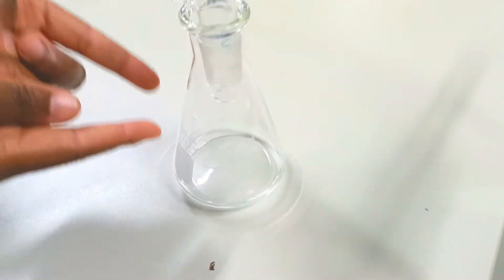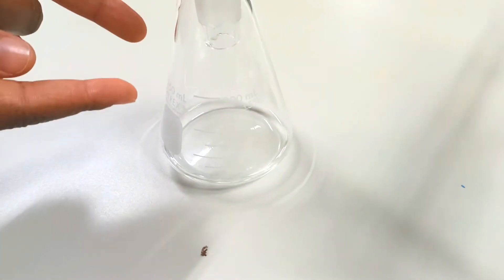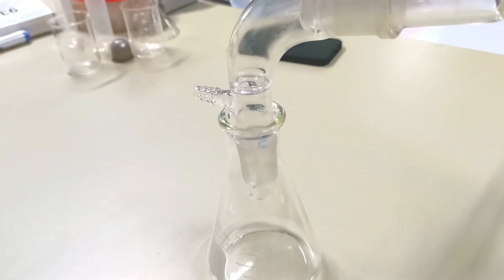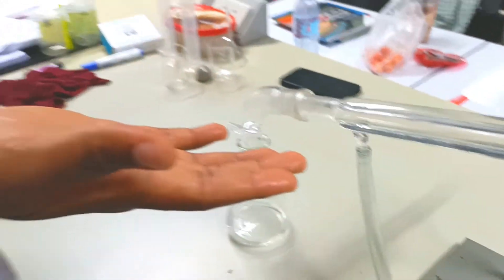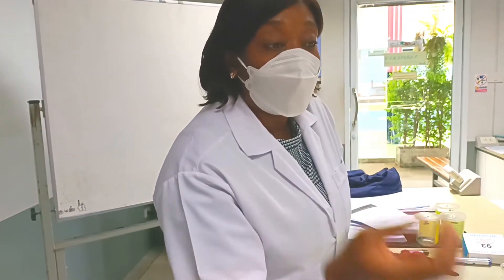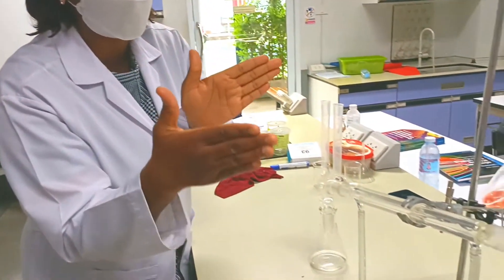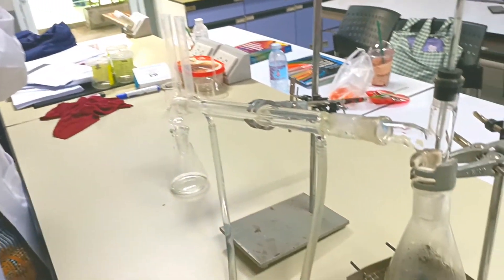So in here, we expect to have our ethanol. By using this method, we separate two mixtures with different boiling points. This is quite similar to simple distillation, but the difference is that these substances have a closer difference in their boiling points.